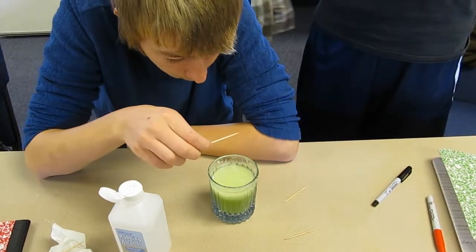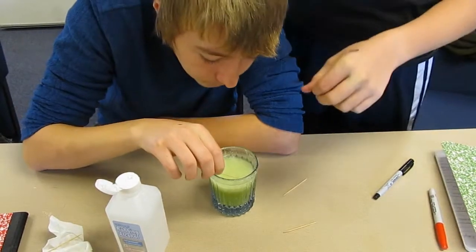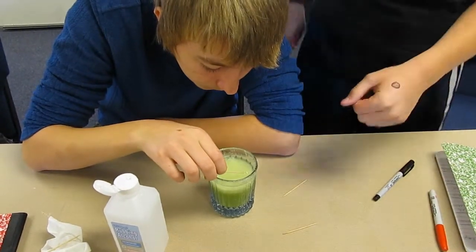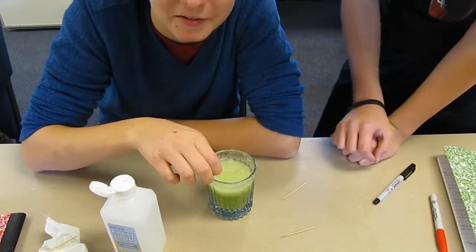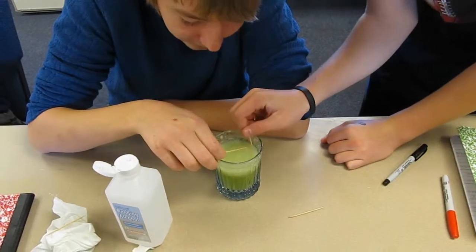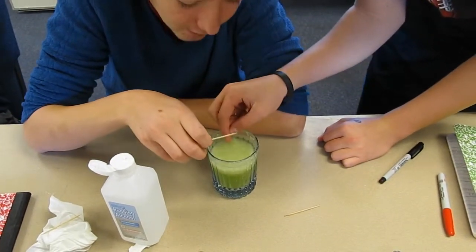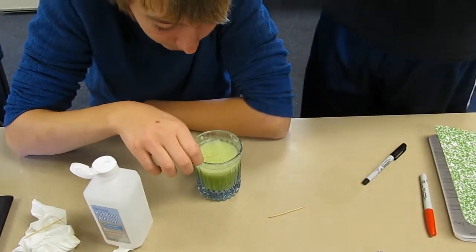Not quite. It's all DNA. I think you're maybe supposed to twist it. I am twisting it. Oh, you are? I can't see the toothpick rolling. You can't just plunge in there. I didn't. He is. I went and did it like this and I got some on it.